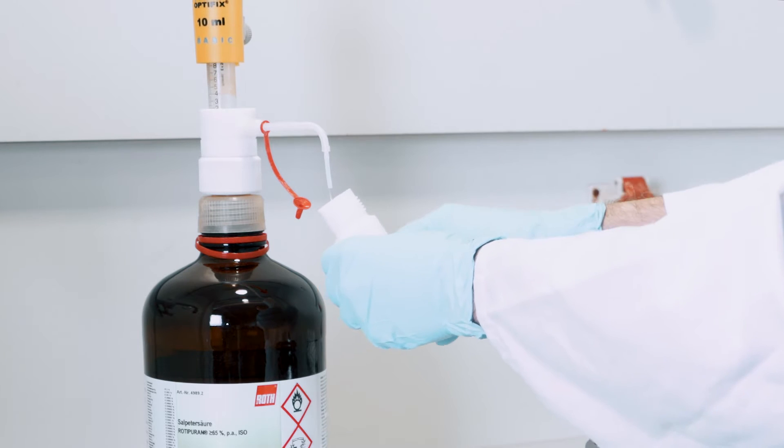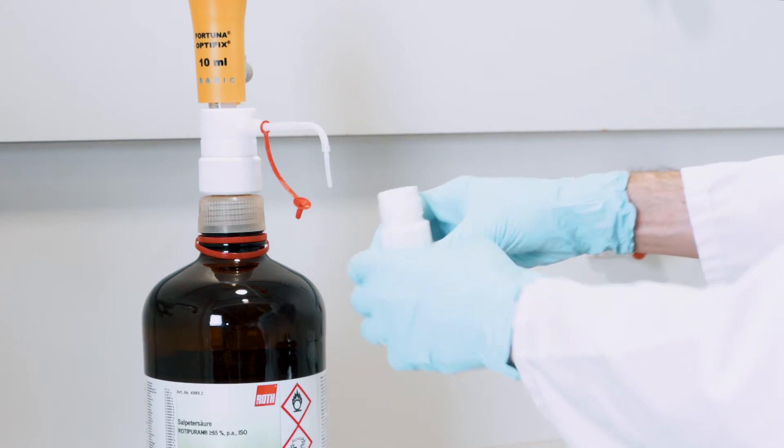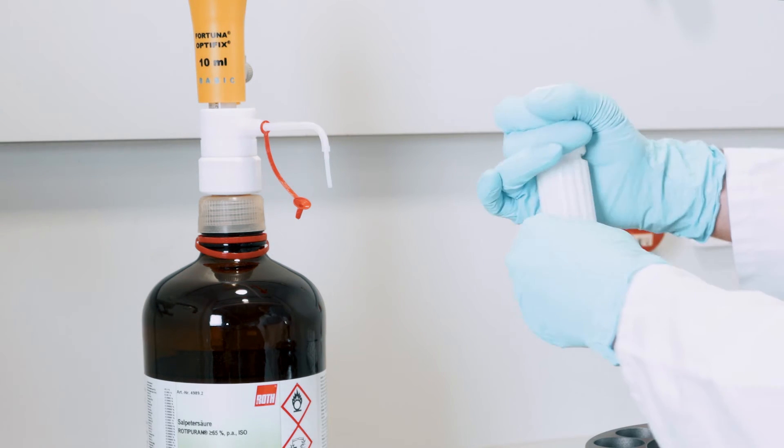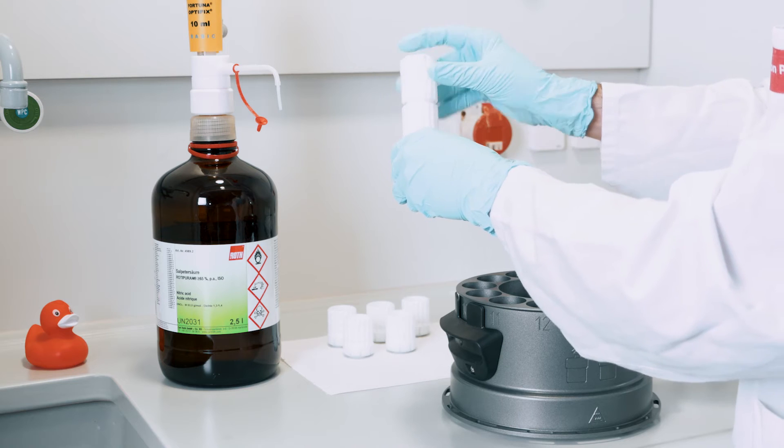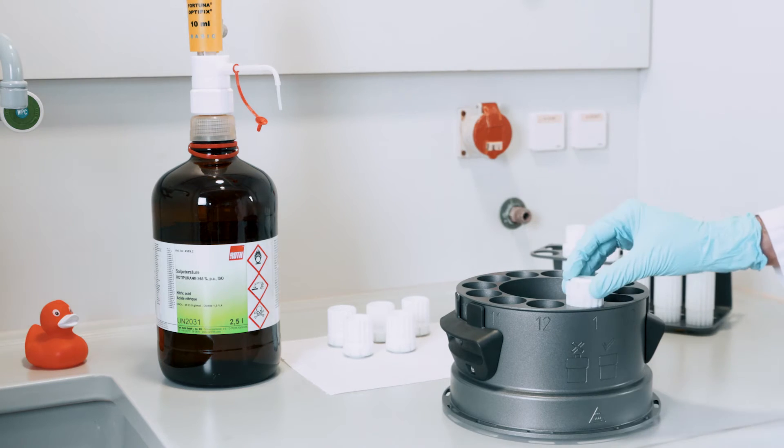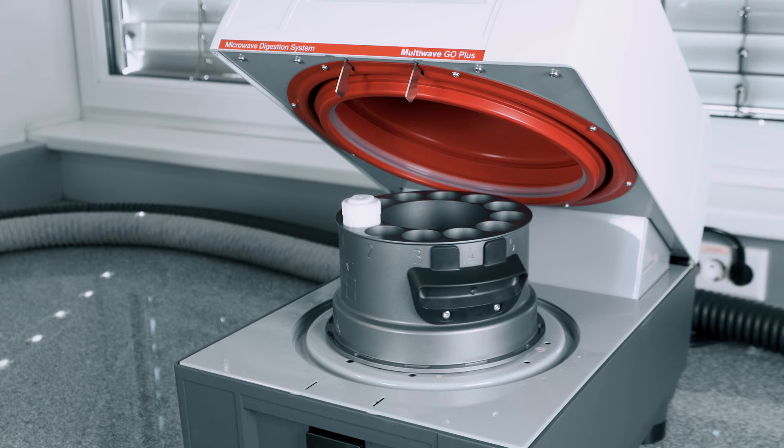Then we add acid and close the vessel. Very easy. We can place up to 12 vessels in the lightweight, pressure-resistant rotor. If you have just one sample though, there's a special mode especially for that.